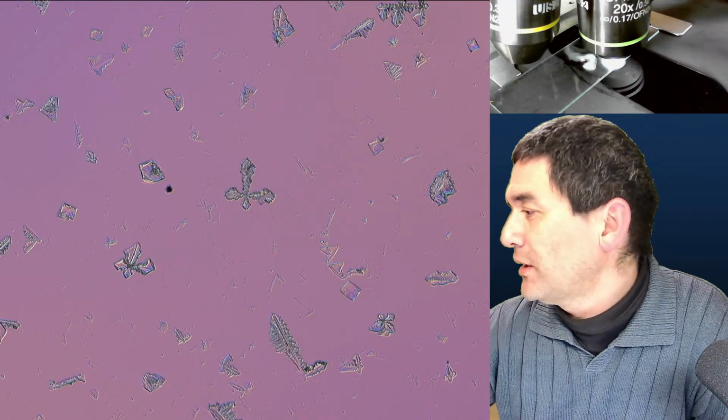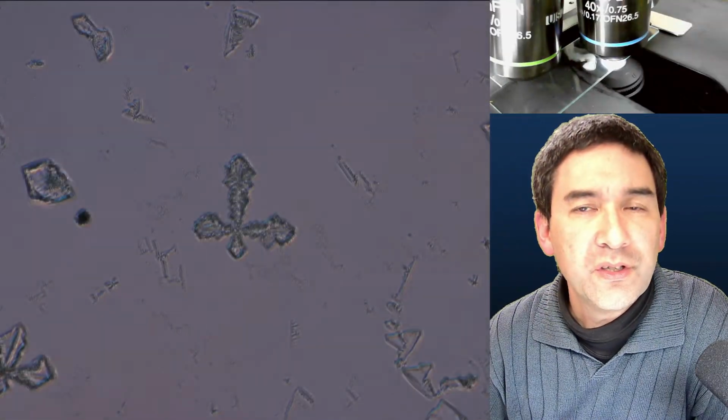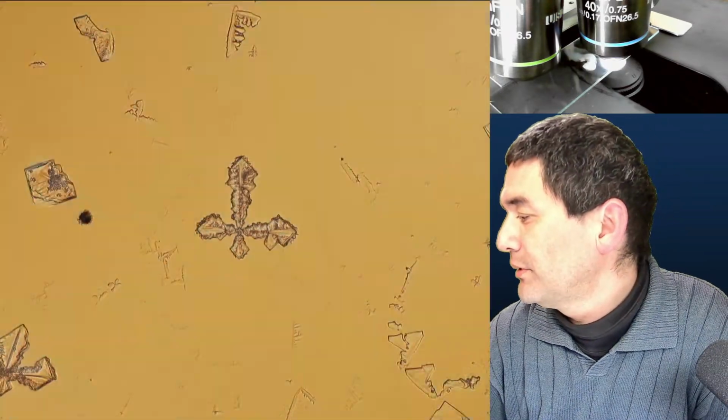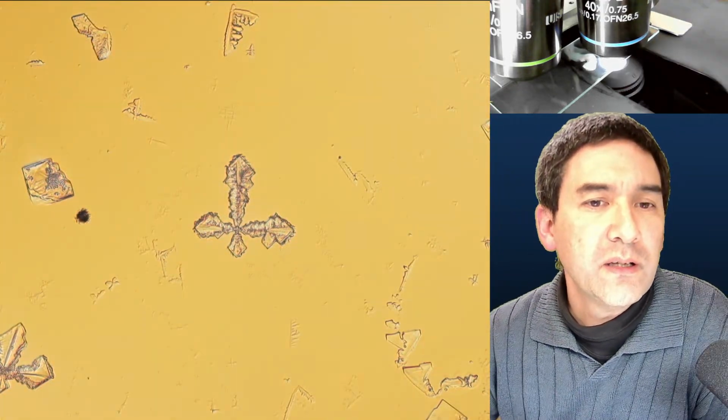So you just take a cold microscope slide, and now I can actually go up with the magnification yet further, because it's so thin. Let's move this up here as well, with a different filter, so that we can change the color again. Ah yeah, this is better.